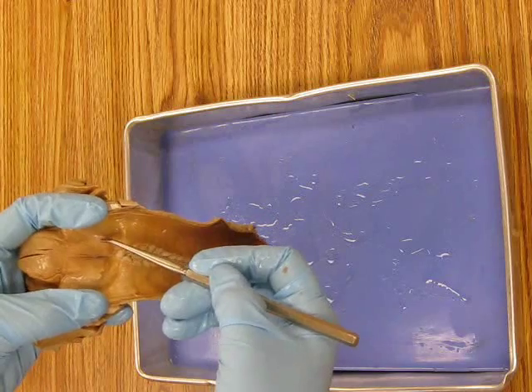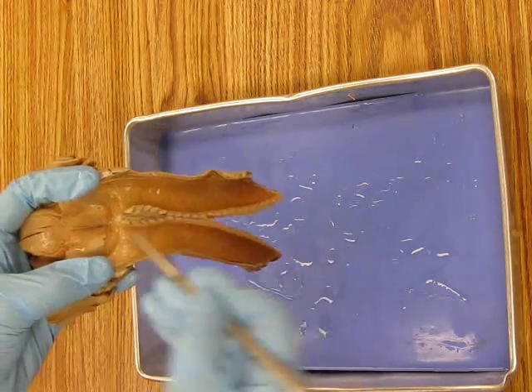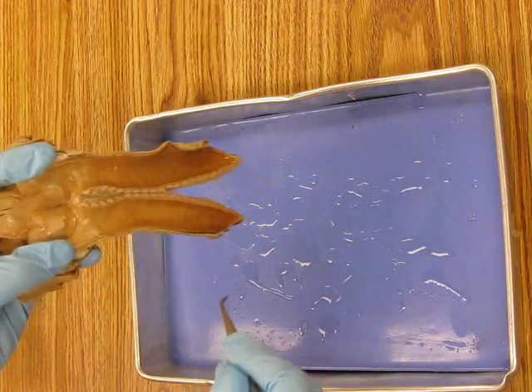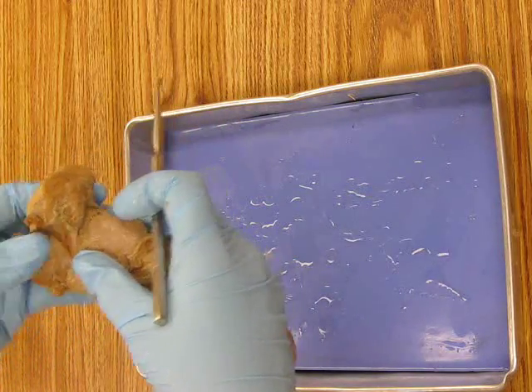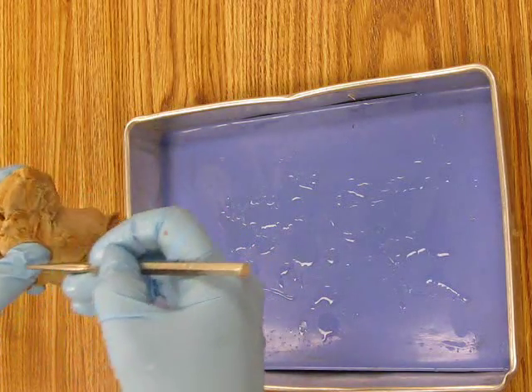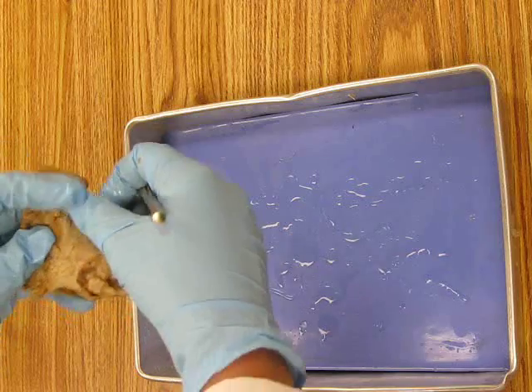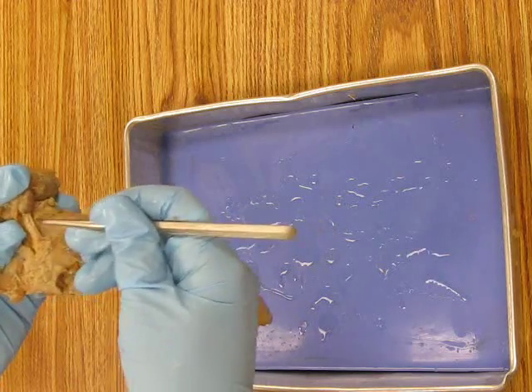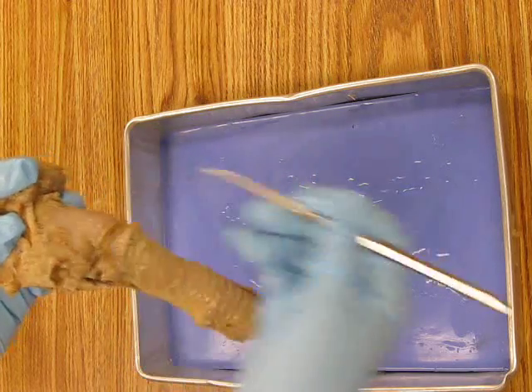And those are the ones that are connective tissue strands that as air passes up through the voice box, they cause those vocal cords to vibrate, which makes sound waves in the air. Okay? Alright, we're also going to be identifying the hyoid bone. And the hyoid bone, remember, is underneath the mandible. So here's the tongue. The mandible of the animal would be right here. And just underneath that is the hyoid bone. Okay, and it doesn't look like much with the video because it's still covered in a little bit of tissue. But when you have this at your table, you can feel that this is a bone. And you're seeing the one side of the horseshoe-shaped bone, hyoid.